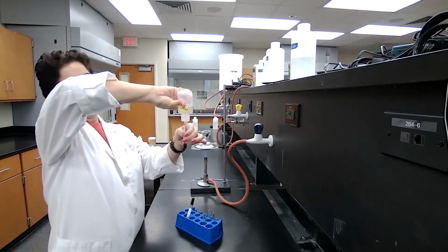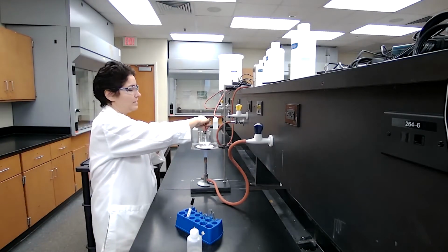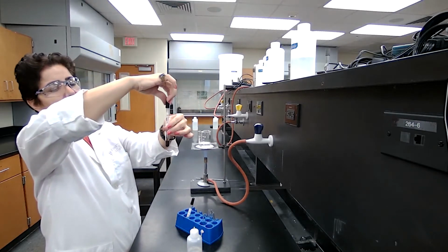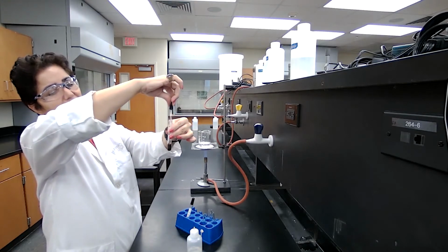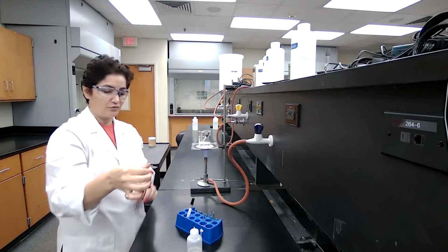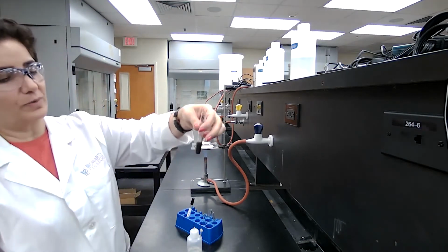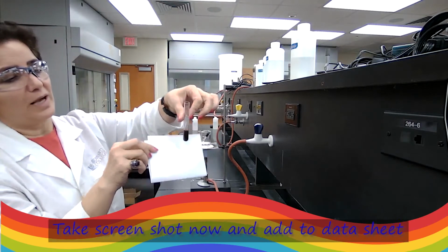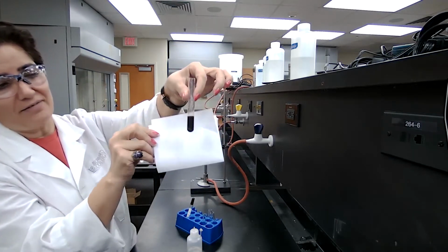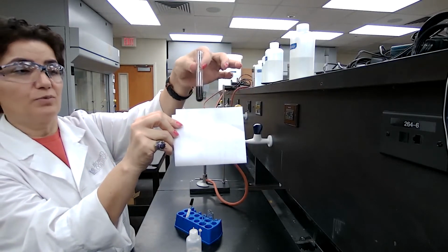I'm going to add 5 drops of hot water. There are two types of procedure here. One procedure says to place the test tube in a hot water bath to get it hot. And another procedure says to add the 5 drops. There are basically two approaches; as long as I can warm up and make sure the solution is hot, it will work. We have the precipitation. You can record your observation and you follow the procedure, moving to the next step.